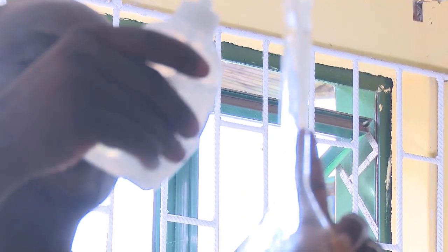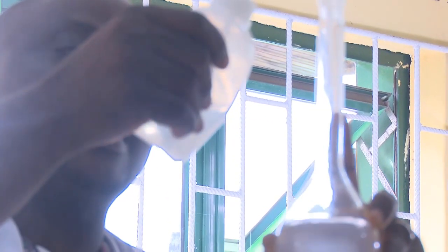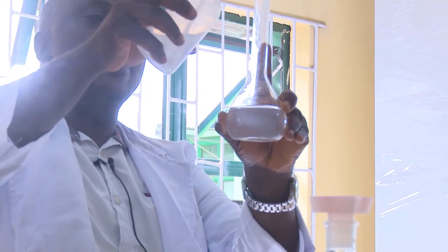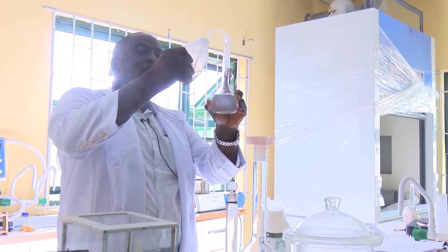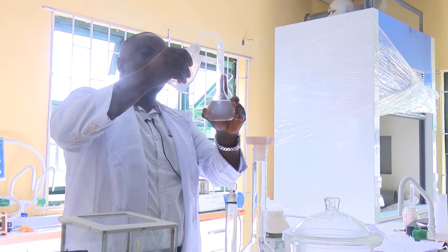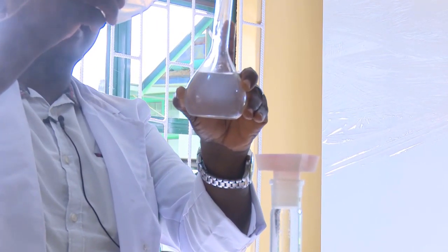That is, when we get to this place, that means we now have 250 mil in this. Now, there is one mistake that students normally make in the lab. When you are doing this preparation, you are not to do the dissolution inside your standard volumetric flask. You are to do it in your beaker. After doing it in the beaker, then you introduce the mixed salt and the solvent inside your standard volumetric flask.